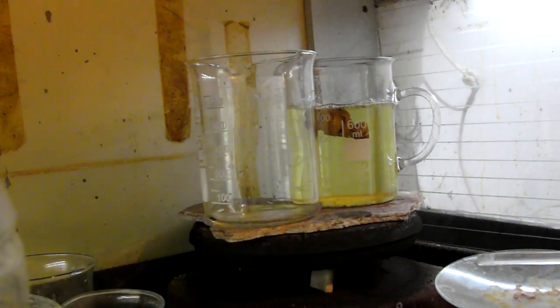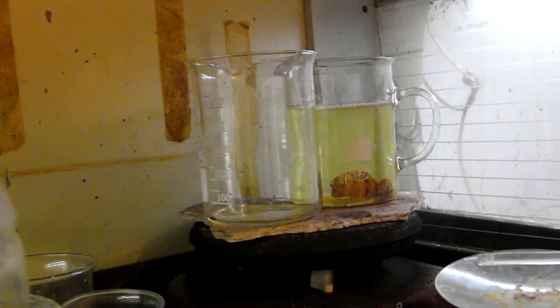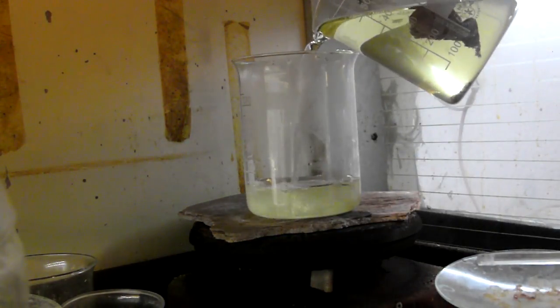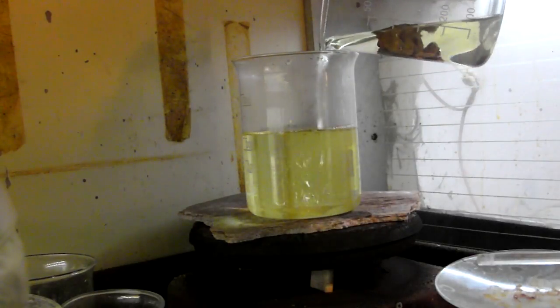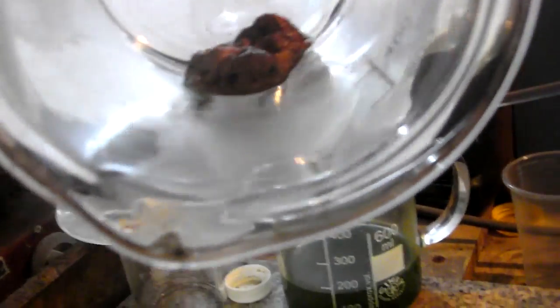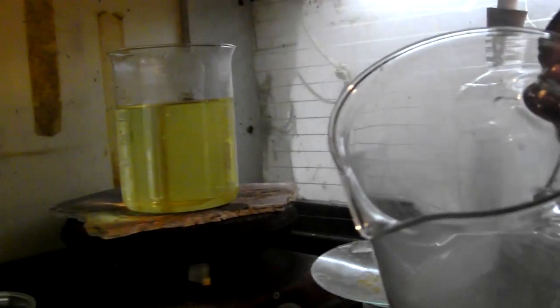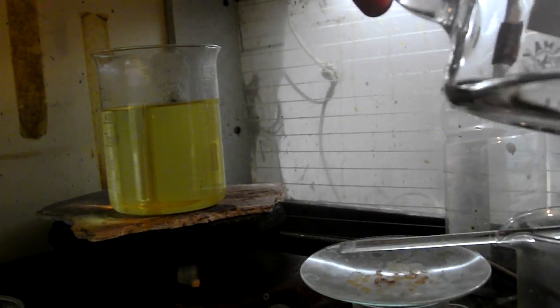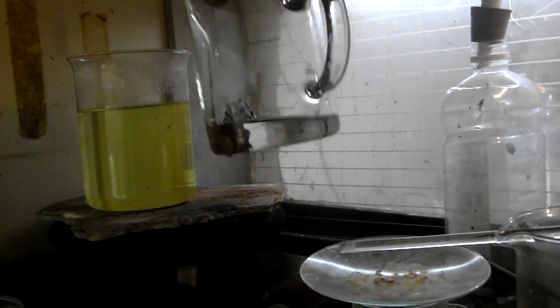I decided to play it safe and decanted the solution into another beaker, leaving the gold mushroom behind. Then I covered the gold with distilled water and left it on the hot plate to boil.